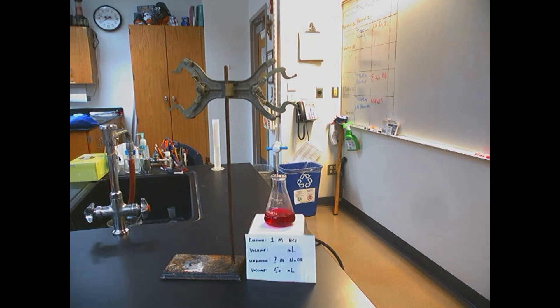We have our burette completely full of our concentration of acid that we know is 1 molar. We do not know the volume of acid that we have to add, but we will know when we get there when the solution turns clear.